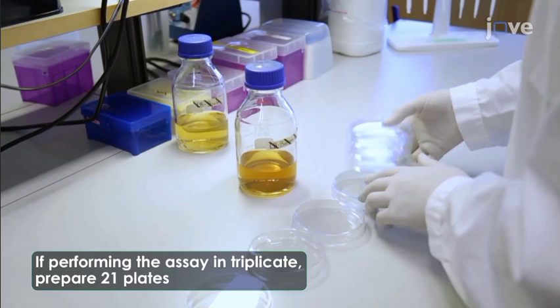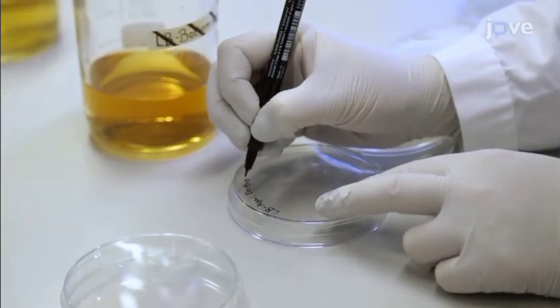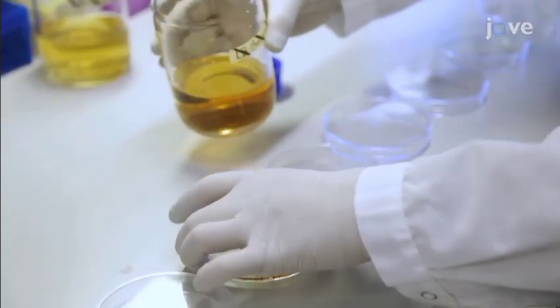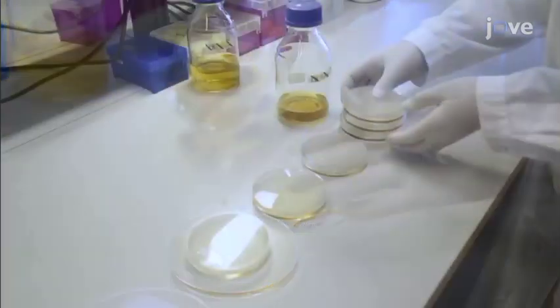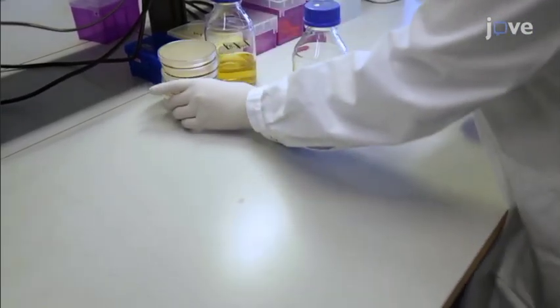Then set out 7 clean Petri dishes. Label each dish on the bottom with the media name and preparation date. Then pour 15 milliliters of the bottom agar into each of the 7 Petri dishes. Allow the plates to set for a few hours or overnight at room temperature.